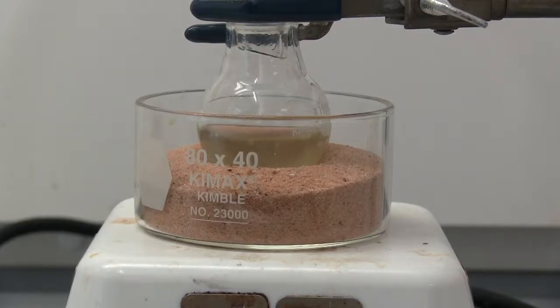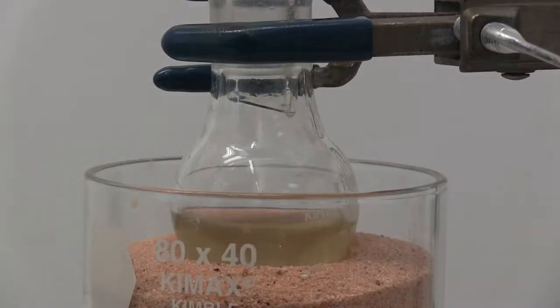And we'll let it reflux for about 15 minutes. All right, now that it's been about 15 minutes, I'm going to turn off the heat and we will begin to work up our solution.